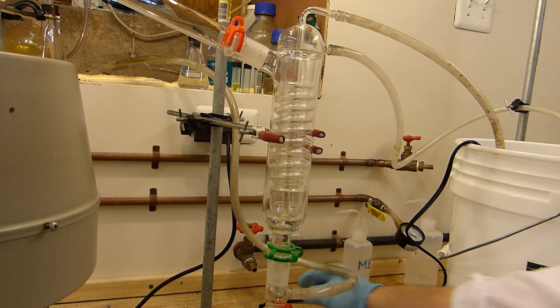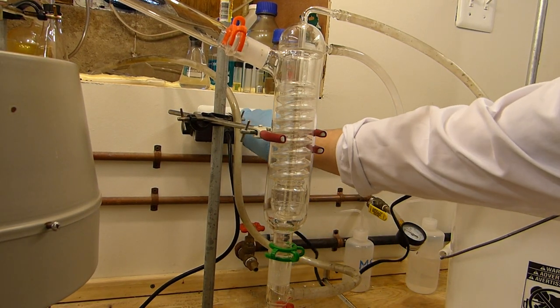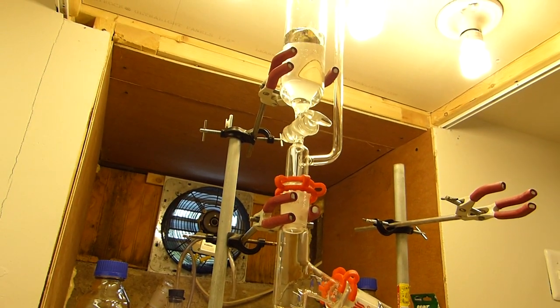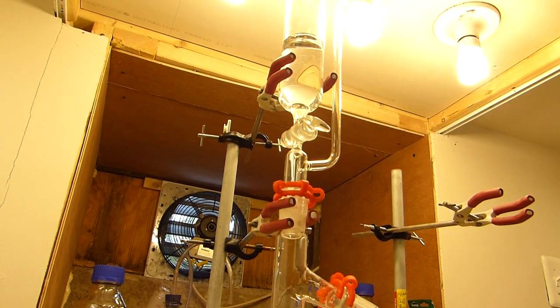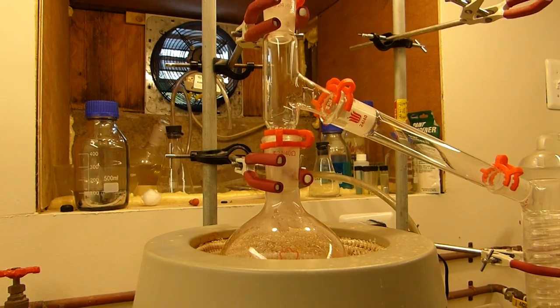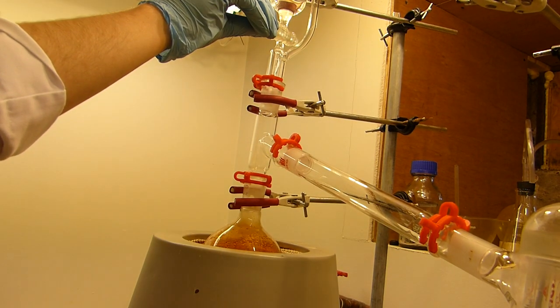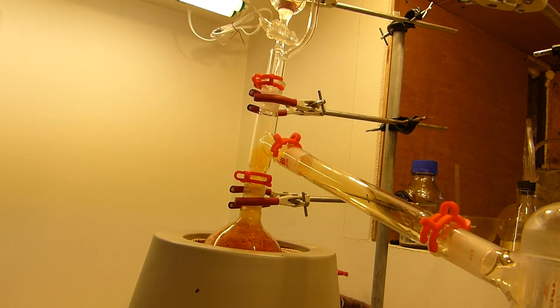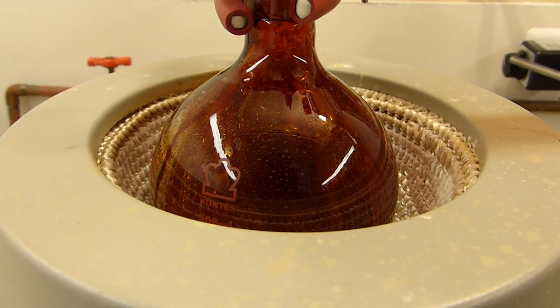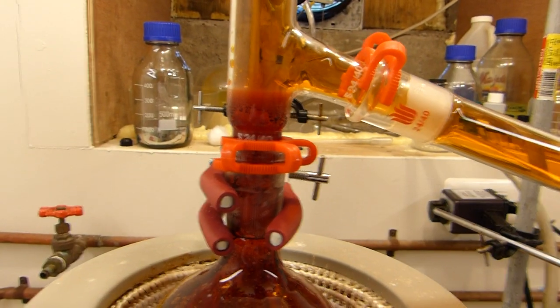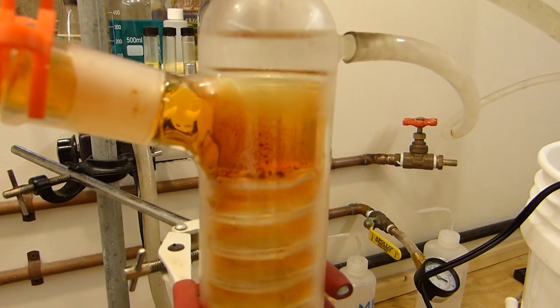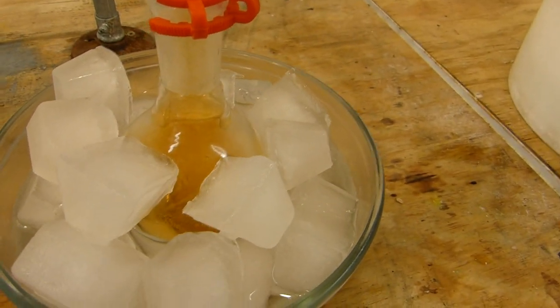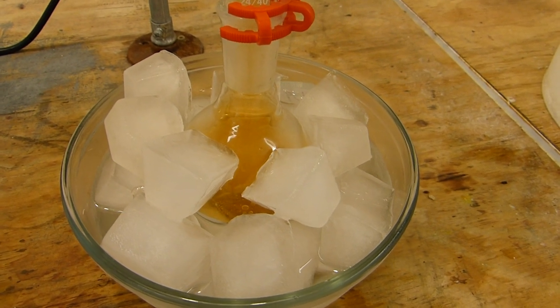We can then turn on the pump and begin circulating ice water through the condenser, causing bromine to form in the boiling flask and distill over. So you can see the flask has gotten pretty dark and the vapor front of bromine is right here. Eventually it's going to make its way over to the condenser and you can see there's already some stray vapors condensing on it right now. And it'll eventually drip into this ice cold receiving flask here. And then we can store it.